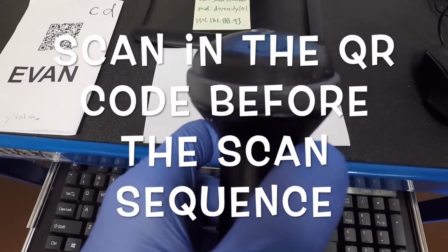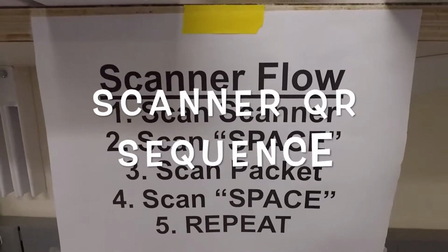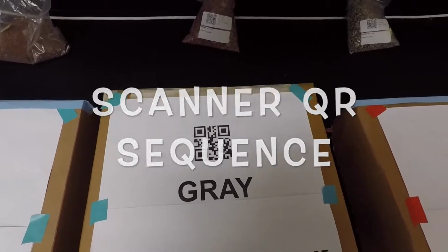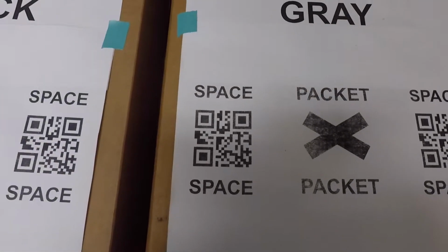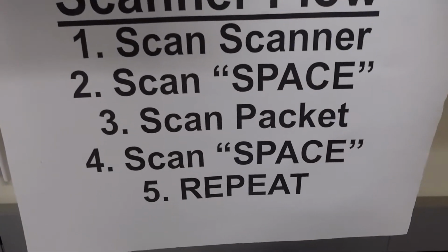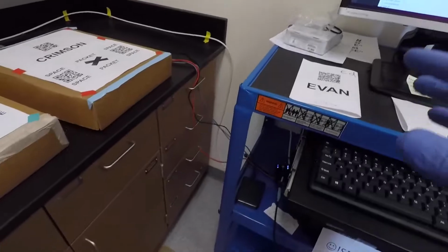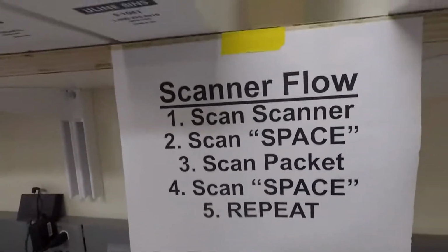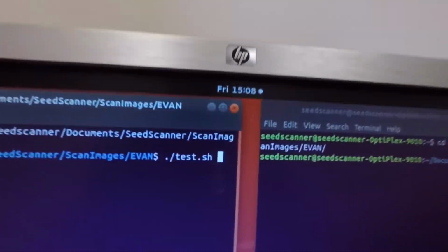So test.sh, there it is up there. So we're going to first scan the scanner name, gray. Then we're going to scan space, space. Then we're going to scan the packet, and I'm just going to type it in to start, and finish by scanning space. And then we're going to move to the next scanner. So again, we did test.sh. It's important to have that, otherwise it won't run these scanners.